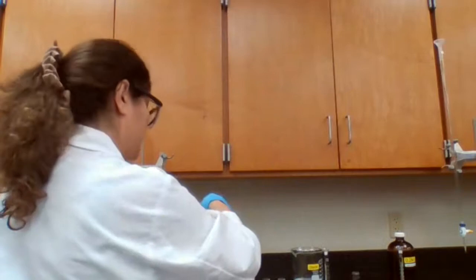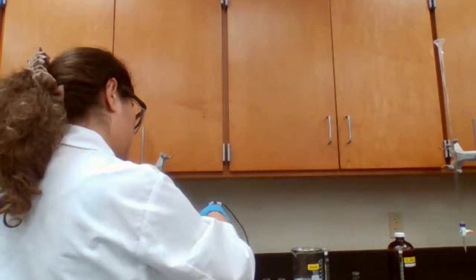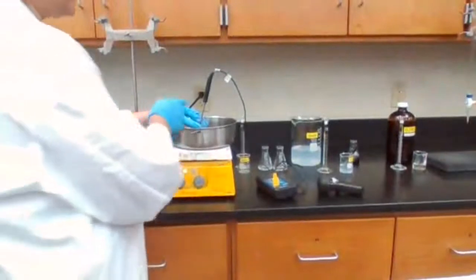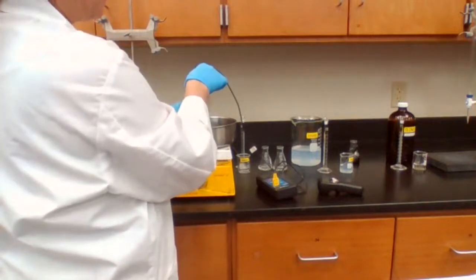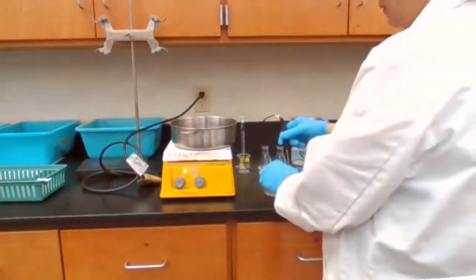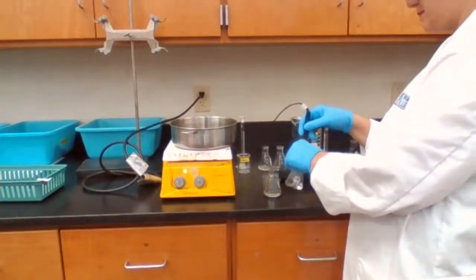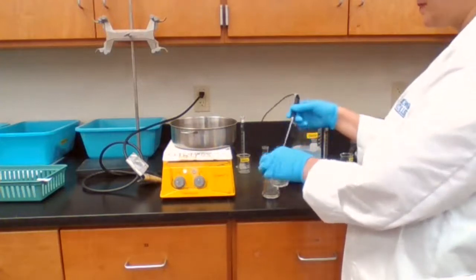So the temperature has to go up. I have to hold both flasks with my hand or clamp them because I don't want anything to flip and give me the wrong result or spill the chemicals into the hot water bath. Okay. Going to mix the two.